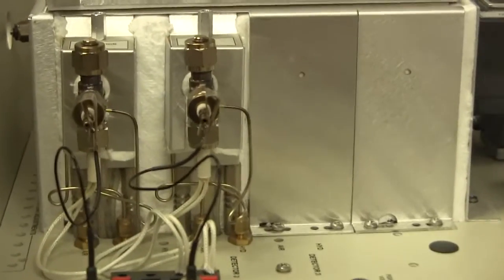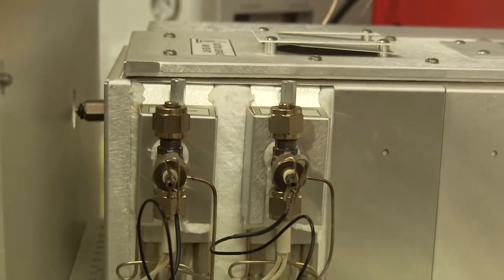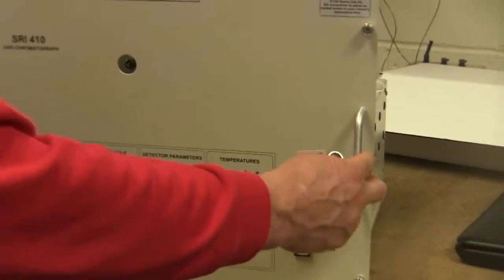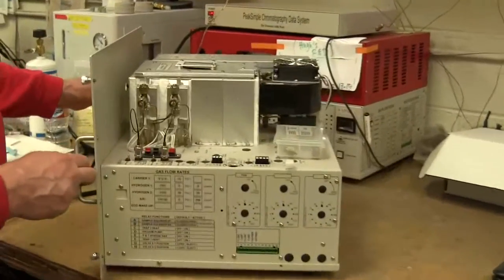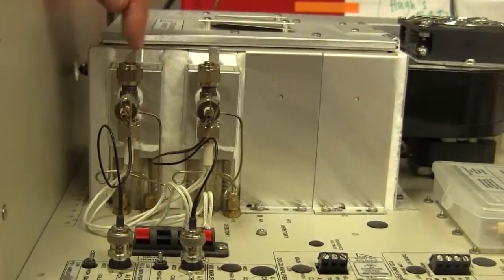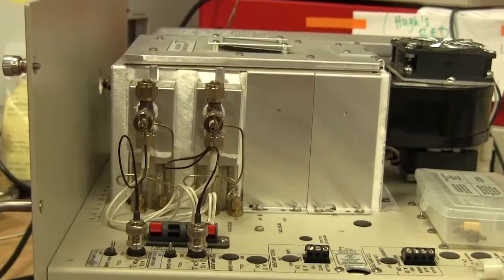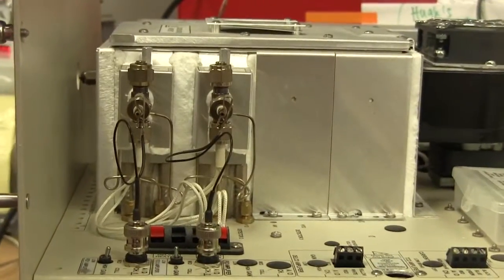So we're switching to a slightly different GC now because it's easier to see on this GC. This is the SRI rack mount version of the GC. So if you had a 19-inch rack, this would slide right in. So this particular GC has two flame ionization detectors. And we very frequently get a question: how do you know if the flame is lit?